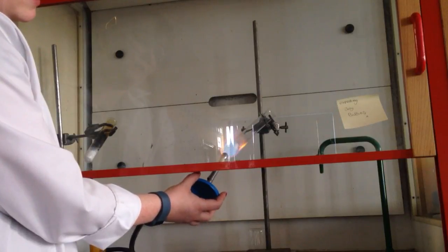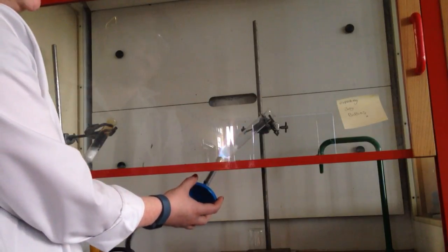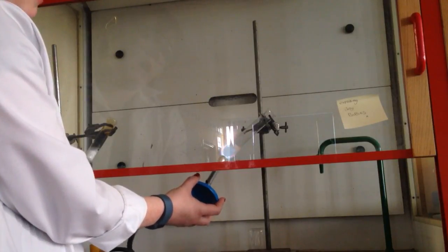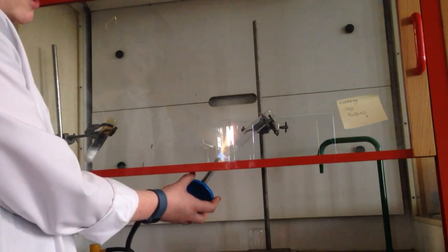The process that's going on here is the same process that takes place in respiration where we have oxygen and sugar releasing energy.